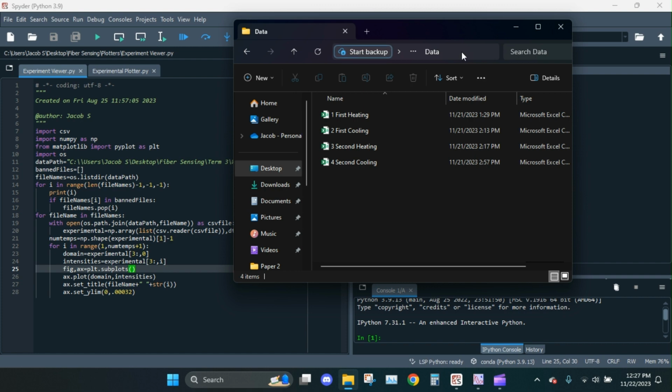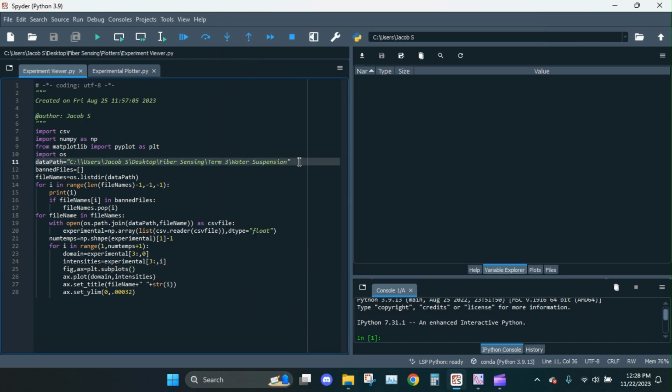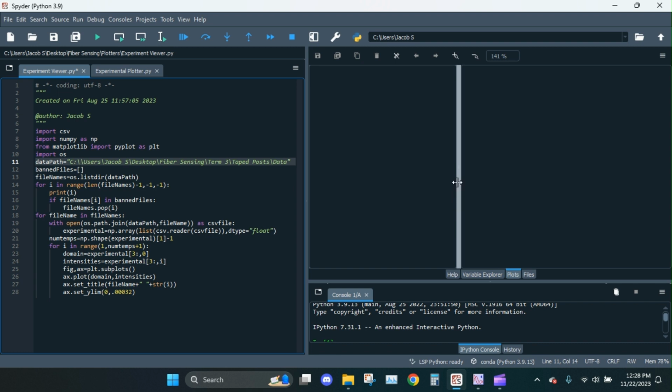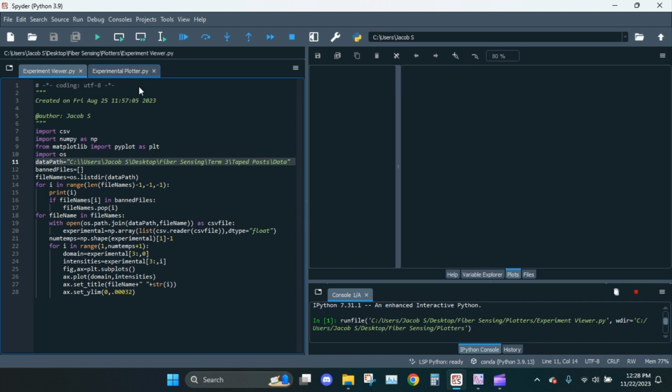There we go. Now what I could do is right-click on the folder. I'm going to copy the address as text, and I'm going to paste it into data path here. It's just the path to the folder. Then a little quirk of Python, this first slash here, you need to put a second one. There we go. Then it should be as simple as hitting run, and we're going to head over to the plots tab, or however you view the plots in your IDE, and we'll watch it go.